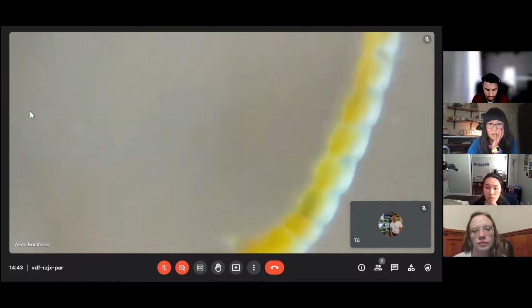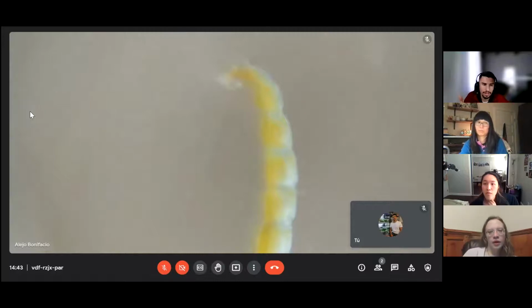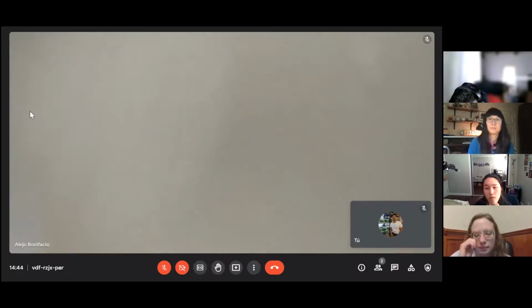But when you preserve in 70% ethanol, they lose the color. Because of that, it's very important to use the step-by-step activity of the bioindicators to see it in the field alive, and you don't need to kill them, if you don't like to do that. Well, that is a preserved bloodworm, but sometimes it's useful to have these animals dead and preserved, because in ethanol they maintain for a lot of time in this condition, and you can see it to remember how a bloodworm was, in one of the last instars.